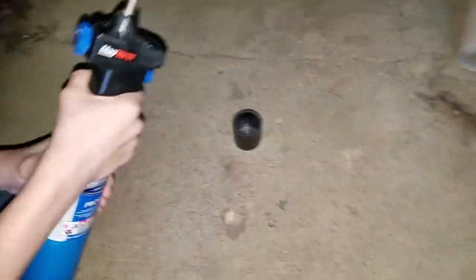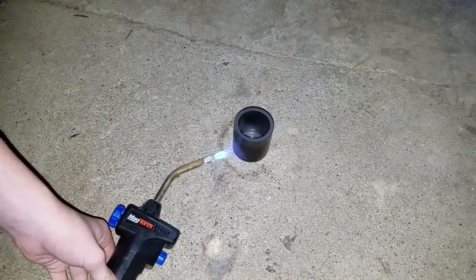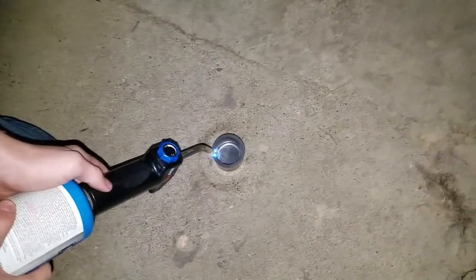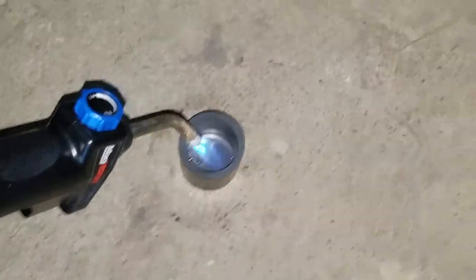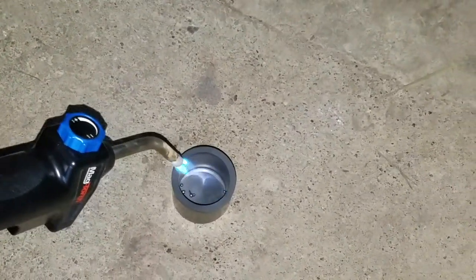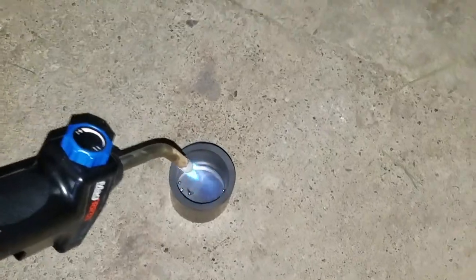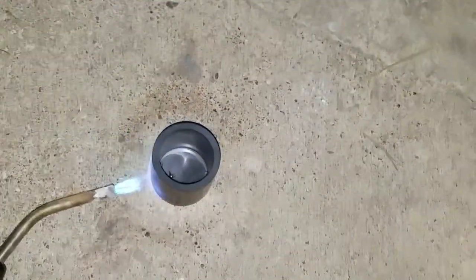I dropped my phone while the torch is running. Smells good. Try to get the middle of it. Did we get anything to move the torch with? No. Did we get anything to move the crucible? No. Well, crap. That was a good setup on our part. I should just grab it. Oh man, that was a very good idea. Just do that — I like that idea.